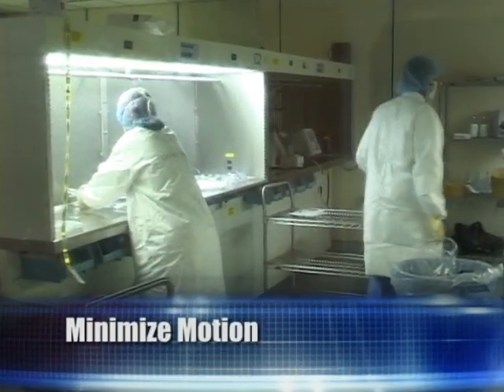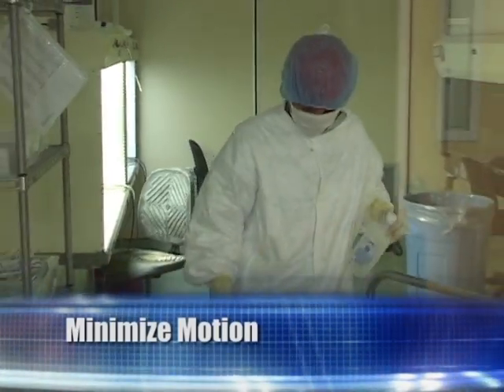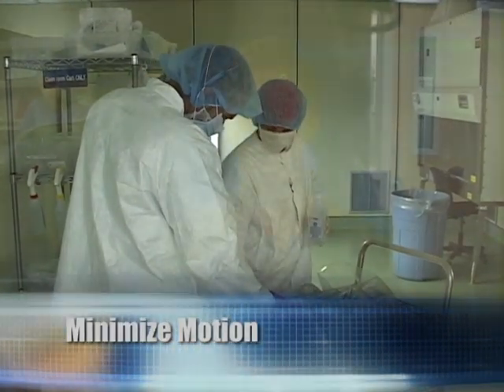Minimize motion. Personnel wearing clean room garments emit thousands of particles per minute even when sitting still. People in street clothes, walking from one change room location to another, release millions of particles. Just like the clean room, the change room needs to be properly maintained to limit the possibility of exposure. Make regular maintenance a part of the daily routine at the facility.